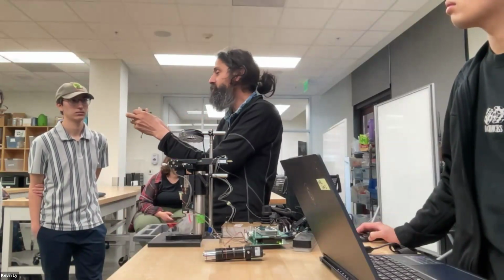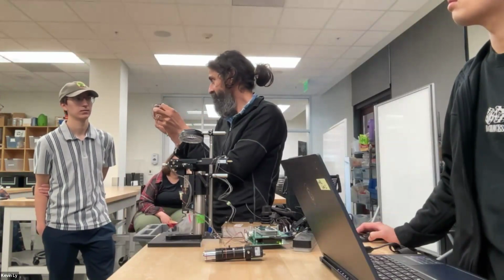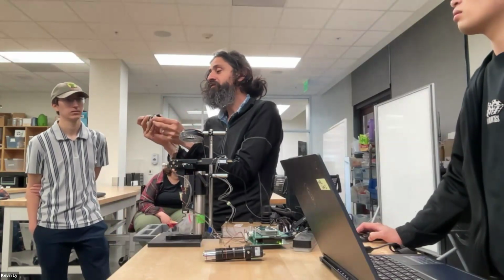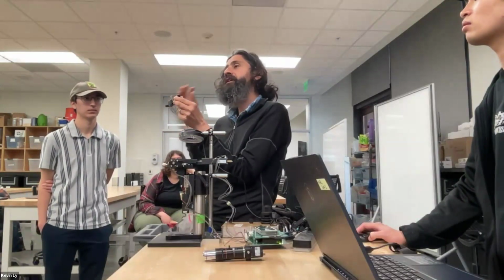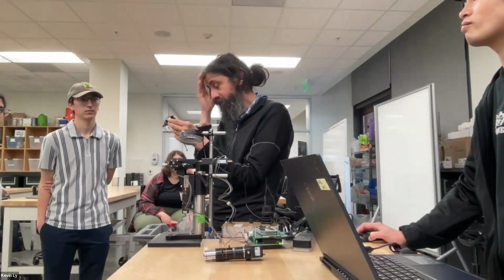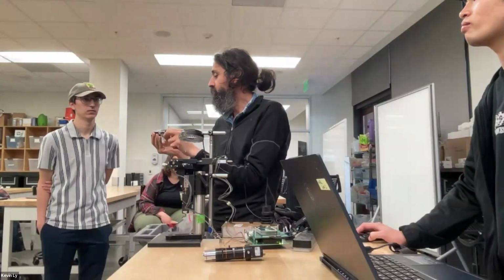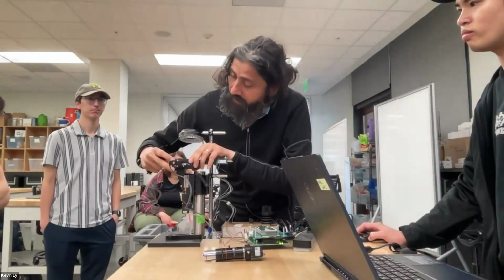A normal motor, when you turn, doesn't actually have the shaft move forward, right? I mean, motors just spin. So you can feel that there is actually a helical track inside. That helical track converts rotary motion to linear motion. And then you ask yourself, oh, now I have this. How do I couple it to a stage? So one of the things is you'll notice that these stages are spring loaded.